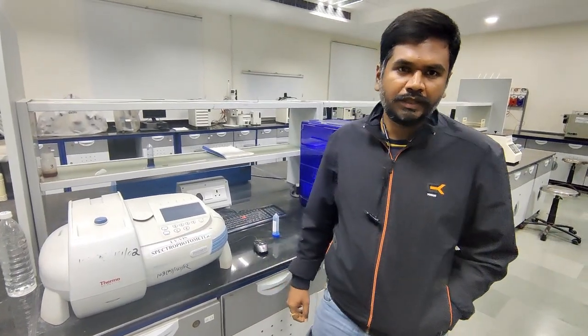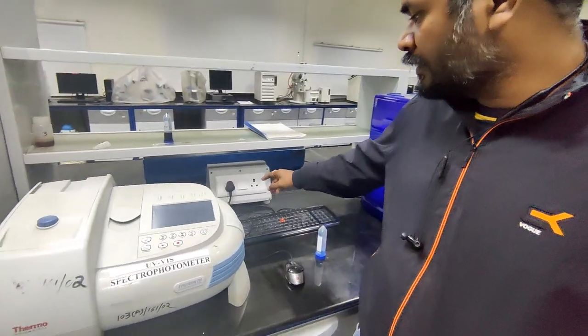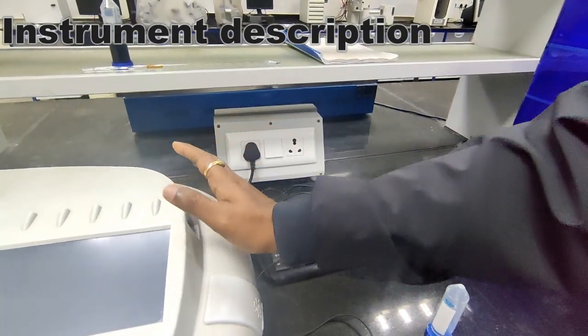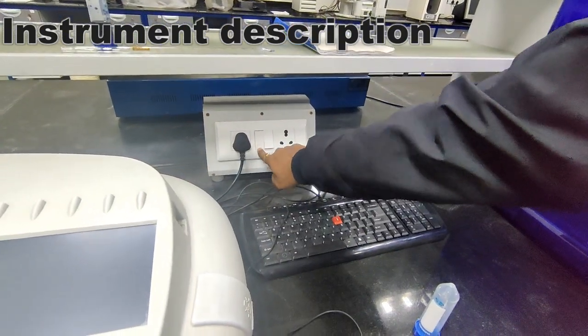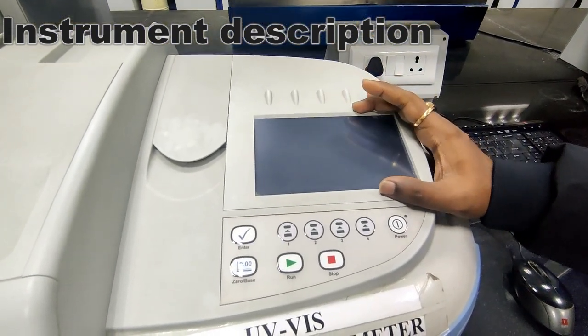Now I'll explain the instrumentation of UV visible spectroscopy. This is a power circuit with which the power is supplied to the UV visible spectroscopy, and here we have a mini display.